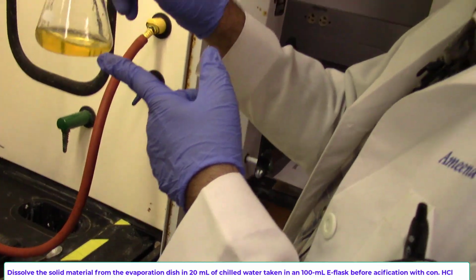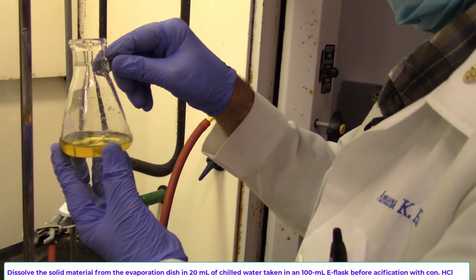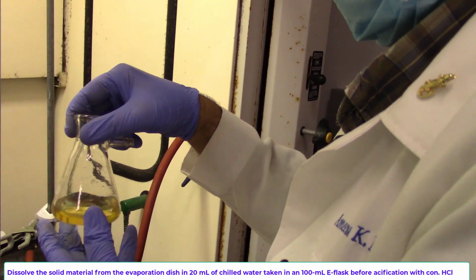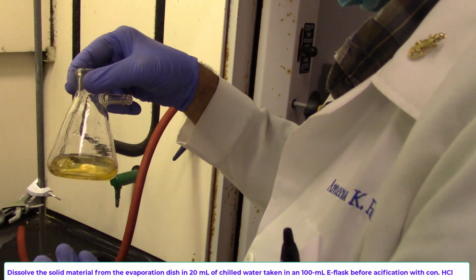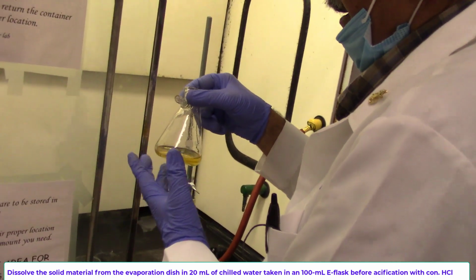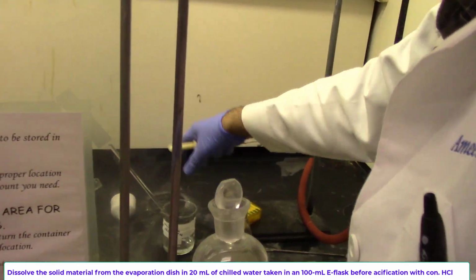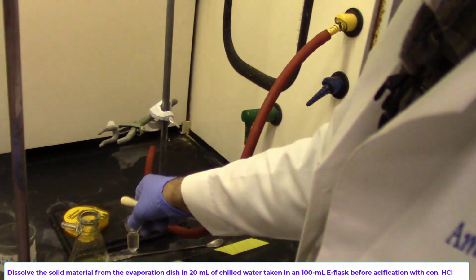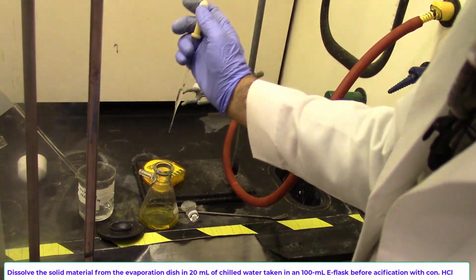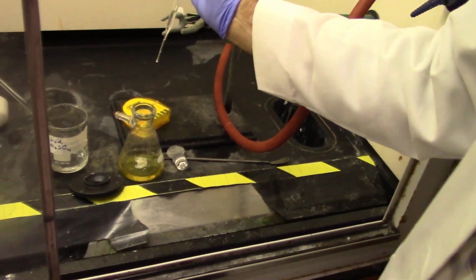So I have dissolved the solid from the evaporation dish into 20 mL of water. Water could dissolve it completely because the solid was only in the form of ions. Carboxylate anion and potassium hydroxide are both soluble in water. Now I'm going to acidify it. Remember, by acidification I'm going to protonate the carboxylate anion, COO negative, into COOH.